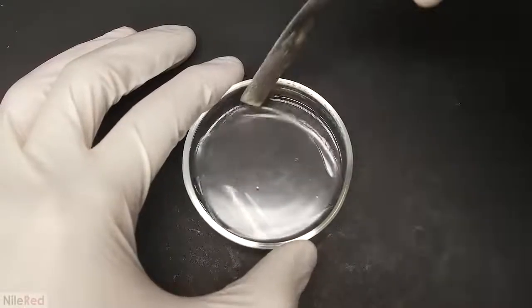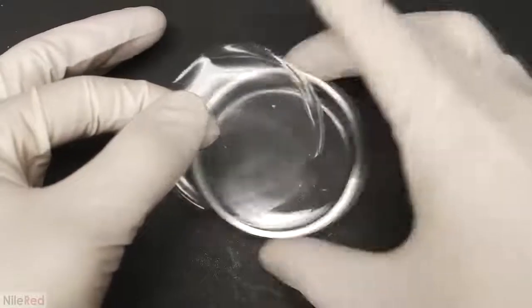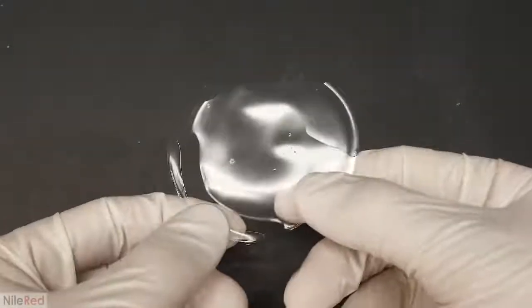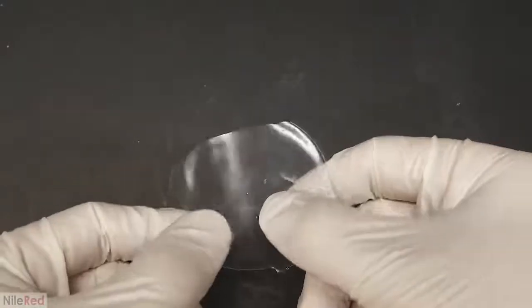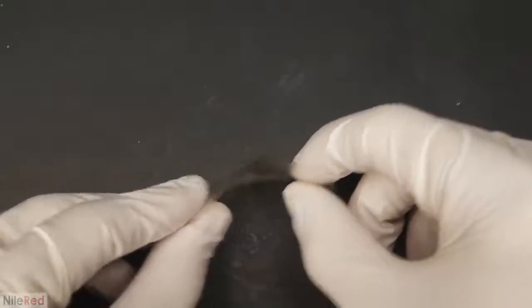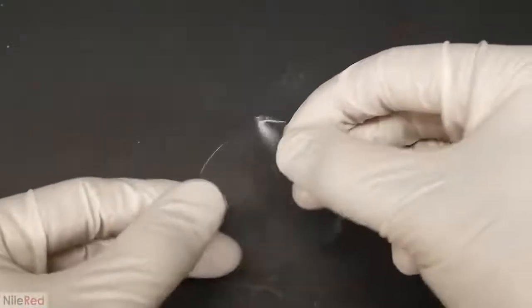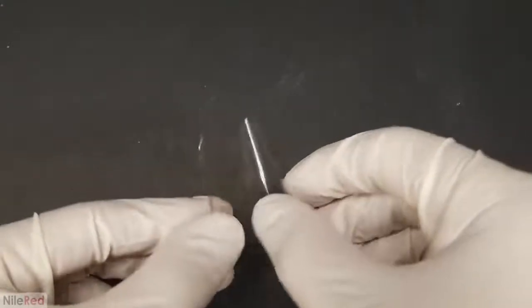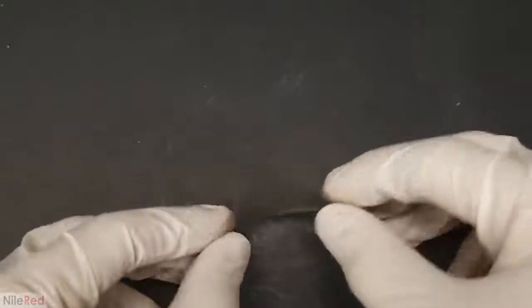I wait for all the solvent to evaporate, and I remove it from the dish. Parts of it were still pretty brittle, but in general, it was a lot more flexible. The quality of my film is definitely still not very good, but you can see that the addition of the plasticizer did get it closer to being a usable product. I think the reason why it's still kind of brittle is because of the low quality cellulose acetate I'm using.